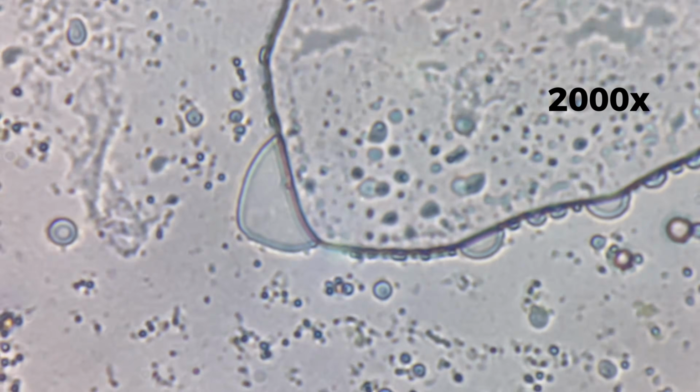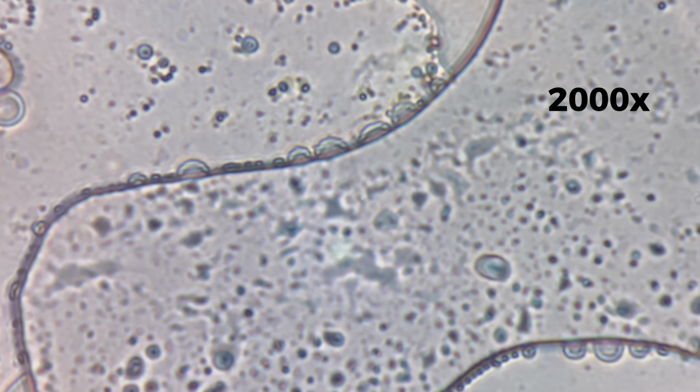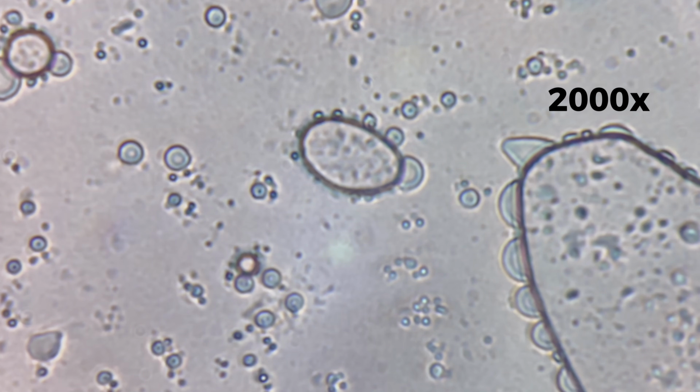Along the edges, countless tiny circular formations line up closely together. They trace the contours of the larger structures, forming repeating patterns. Inside these enclosed regions, the material appears uniform and tightly connected. Every element seems to play a role in maintaining the overall structure.